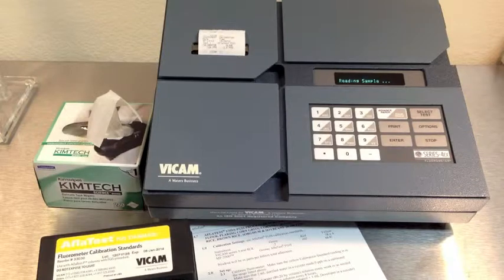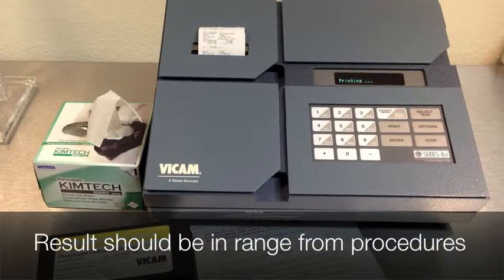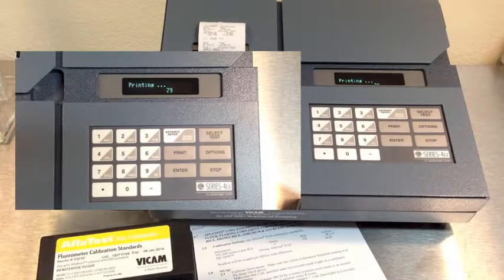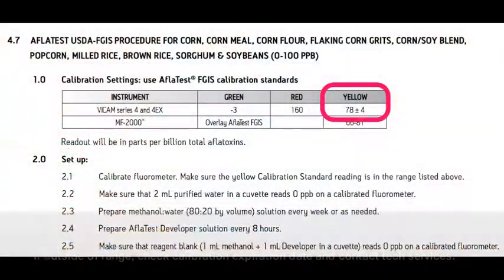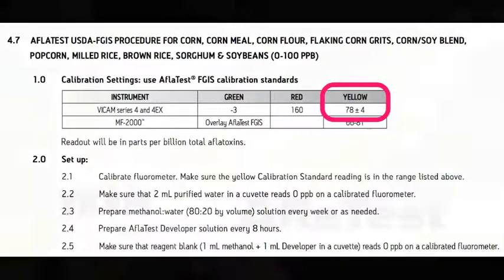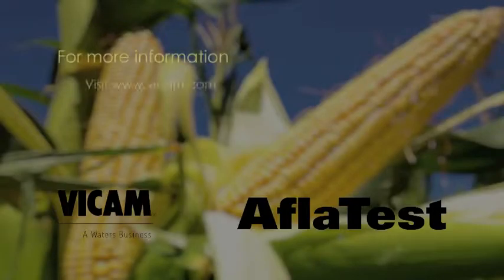After 60 seconds, you will receive a number. Remember, the result from the yellow vial must fall within the range designated in the current procedures manual. Your machine is now calibrated and ready for the day.